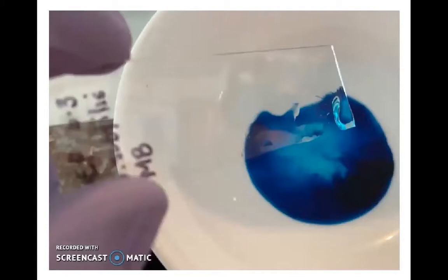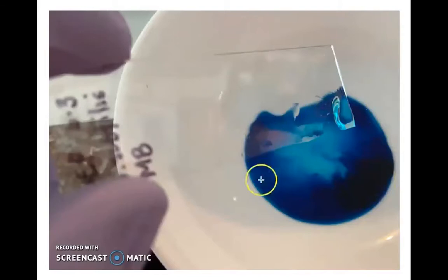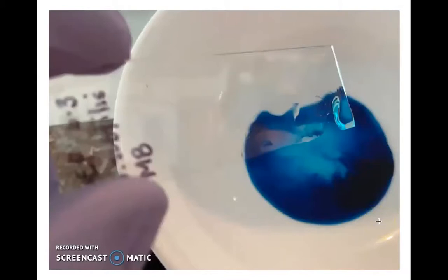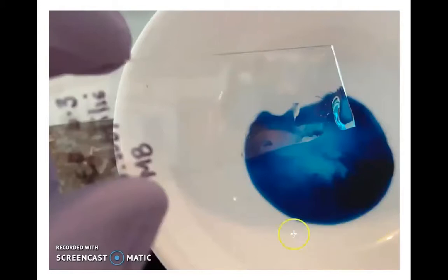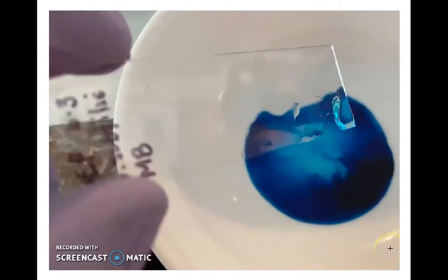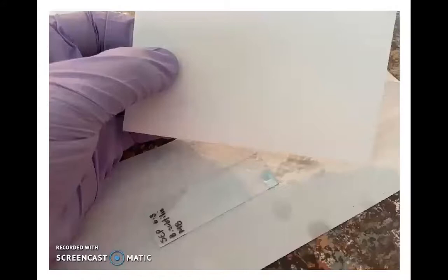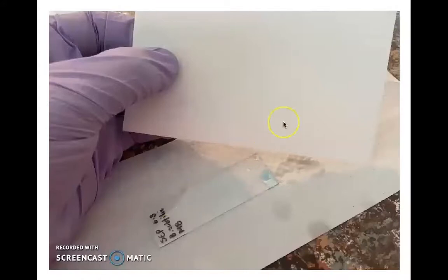All of the stains we use in the microbiology laboratory must be disposed of correctly — collected into a waste container and treated as hazardous waste. The reason we work in staining bowls or staining trays is because we want to collect this waste stain and keep it from going down the drain.